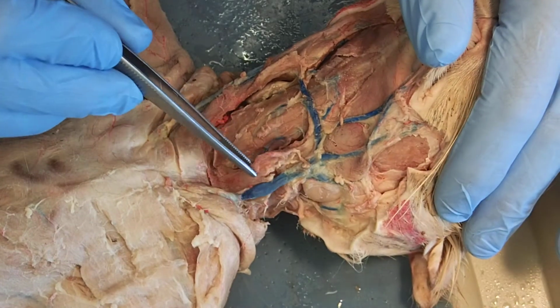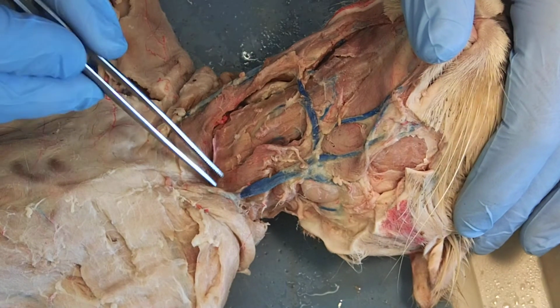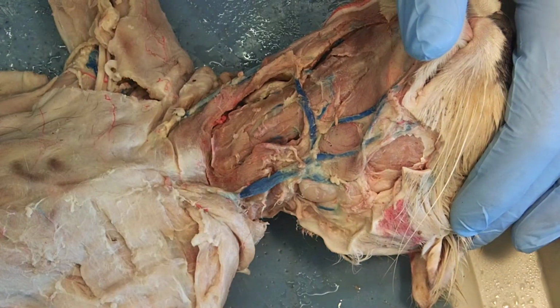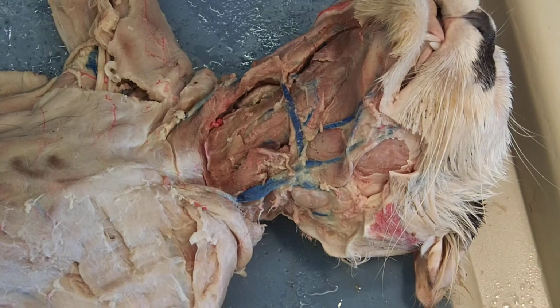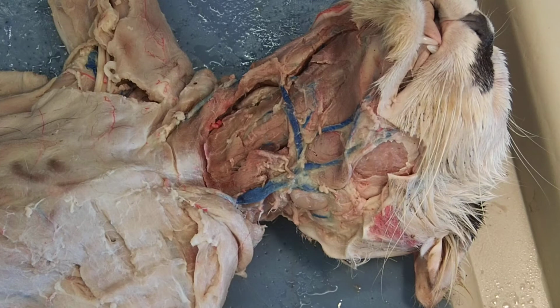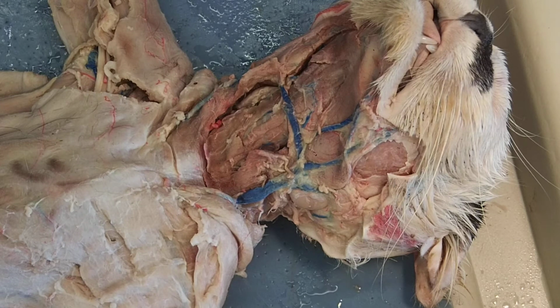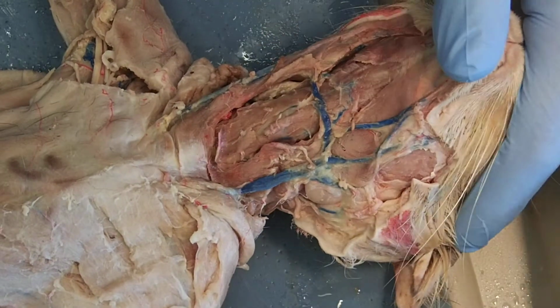And then if we go back to this muscle here, that was the sternomastoid. It's running from the sternum up to the mastoid process in the back of the skull. So whoever named these muscles, thank goodness for them, because they were a godsend. Fantastic. The next few that I'm going to be showing you aren't that self-explanatory.